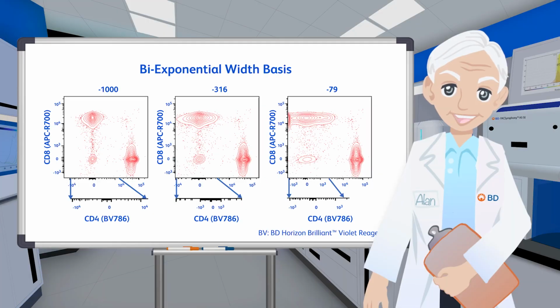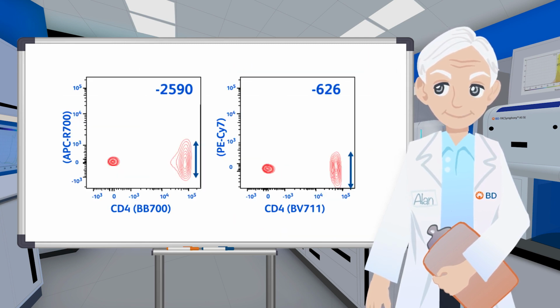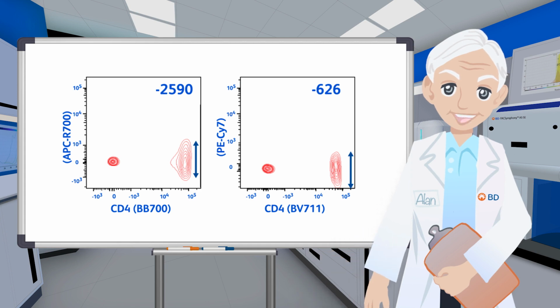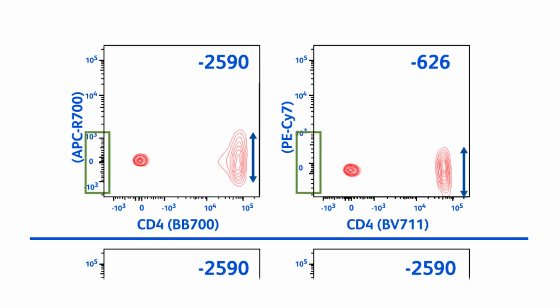When comparing biexponential plots, always look at the axes to make sure that they are equivalent or similar. In this example, the spread of two positive populations of the samples looks very similar, but in fact, the two populations spread are very different. Notice how different the y-axes are, because with different width bases which were used, the data on the left are compressed compared to the data on the right. In most cases where you want to compare data, it is best to manually adjust the biexponential scales to be identical and then apply that scale to all samples as shown here.